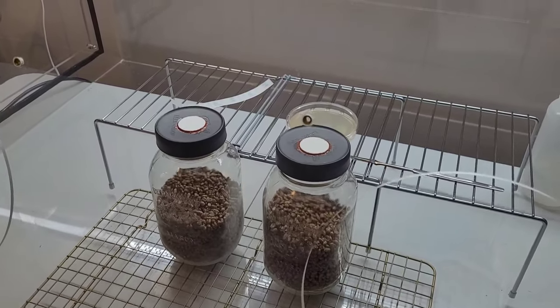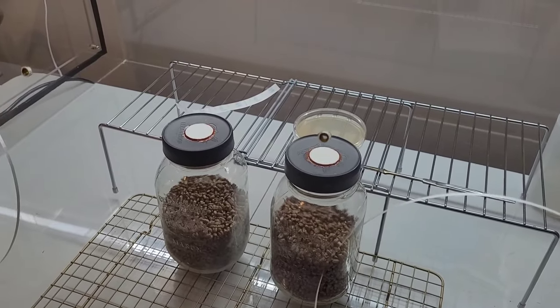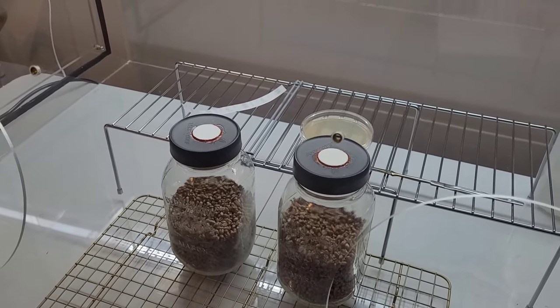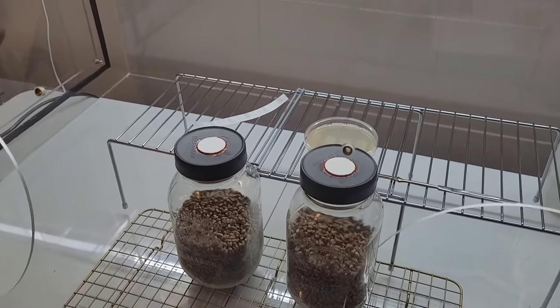Can it work? Yes. Can you get mushrooms? Yes. Is it the most effective way to get sterile, axenic cultures? It absolutely is not.